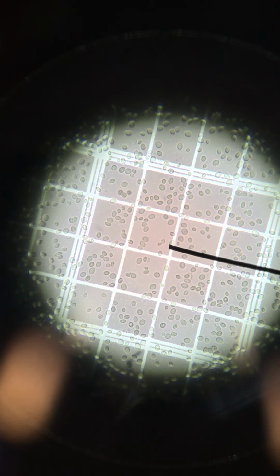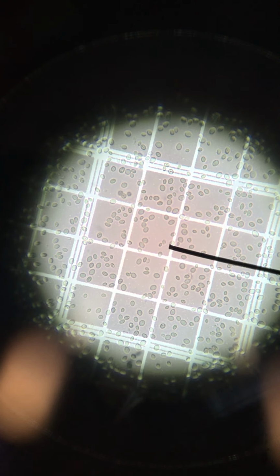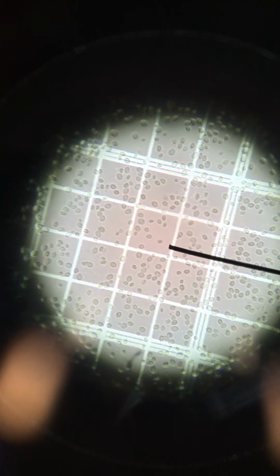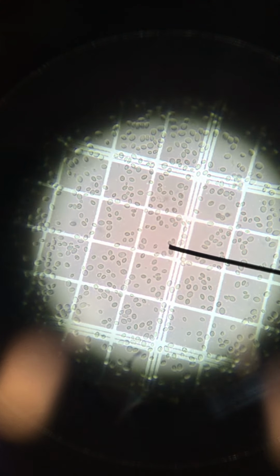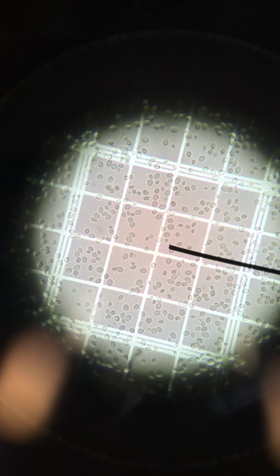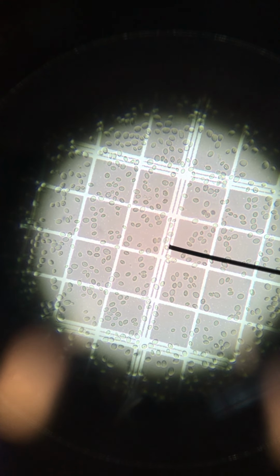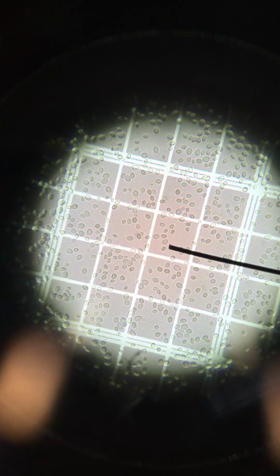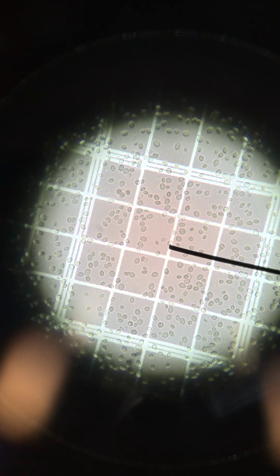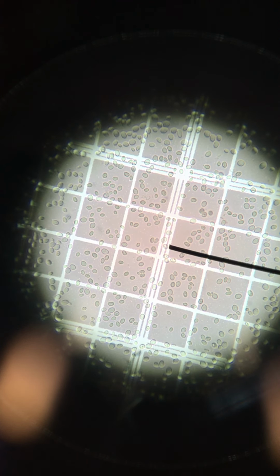Now, one convention in counting cells with the hemocytometer is about the cells that are on the very edges. Say you were counting not just this very corner cell, but also the one immediately to the left of it. What would you do to count a cell that was right on the line between the two? If you were first counting this one and then counting the one on the left and then moved over to the cell on the right, would you double count that cell? And of course the answer should be no. But how do we make sure we don't double count?